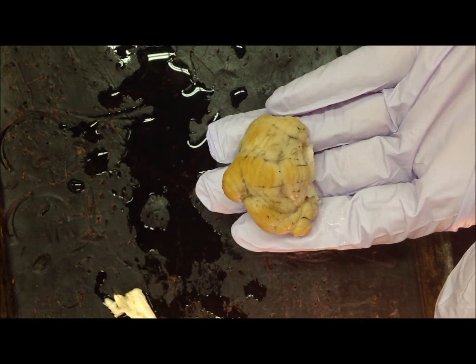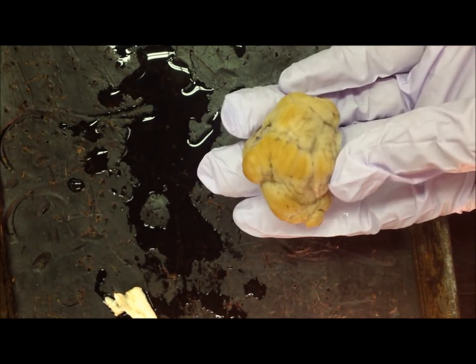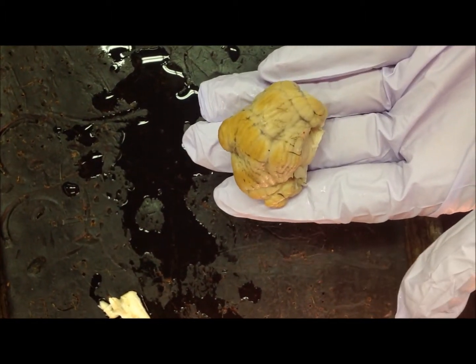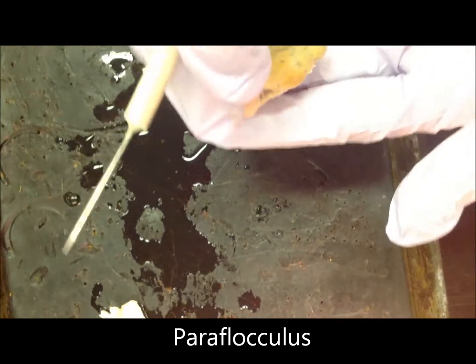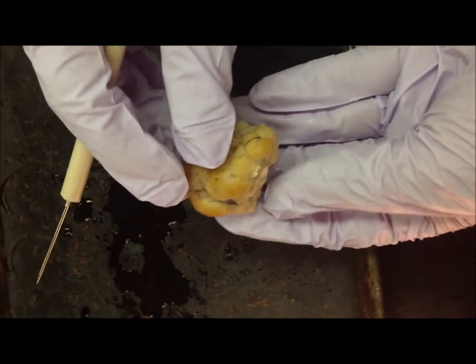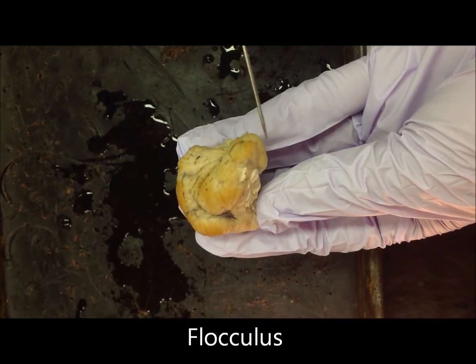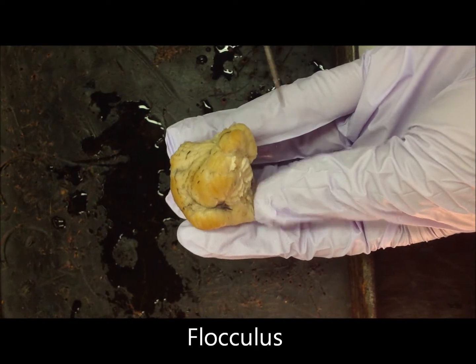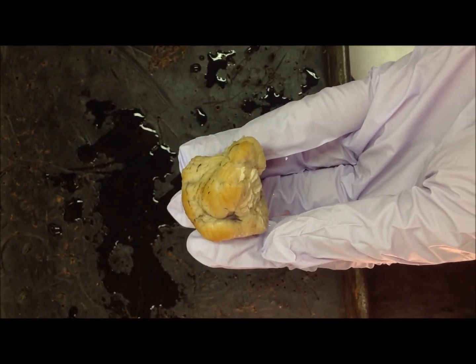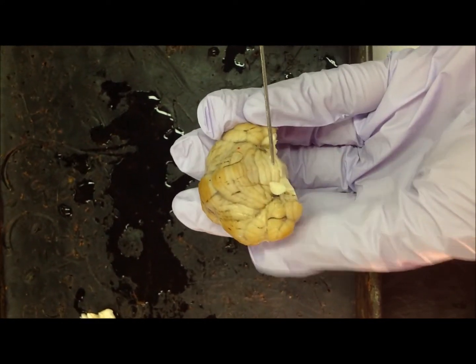We will now take a look at the exterior view of the cerebellum. To distinguish the anterior from the posterior of the cerebellum, locate the paraflocculus, which is the most lateral structure, and then protruding from that is the flocculus. Follow the direction in which the flocculus points. It points towards the anterior of the cerebellum. So as you can see, this would be the anterior of the cerebellum.